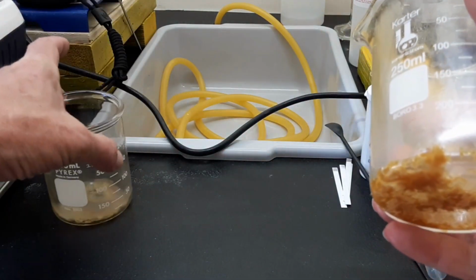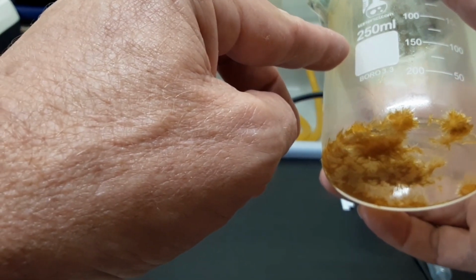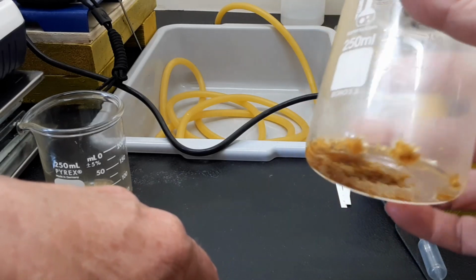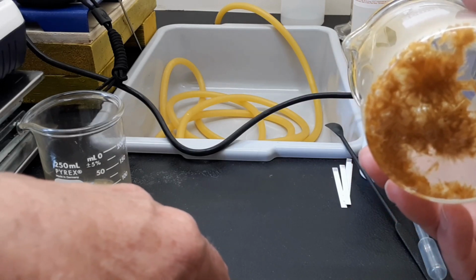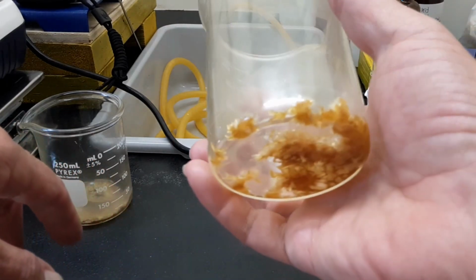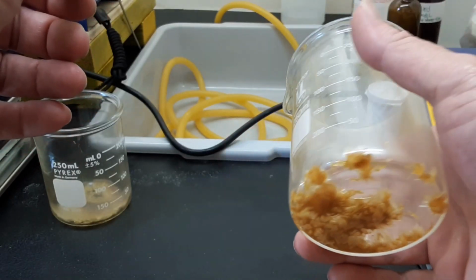An interesting note, comparing this to the first failure over here: when I poured this into the funnel filter, it looked like brown, granular, kind of in appearance, peanut butter. So why do you get something that looks like brown peanut butter on white pepper but not on black pepper? I just don't know. This one here did not have any refrigeration done to it at all. It sat for about 17 hours at room temperature. And this was done in a 15% potassium hydroxide solution.